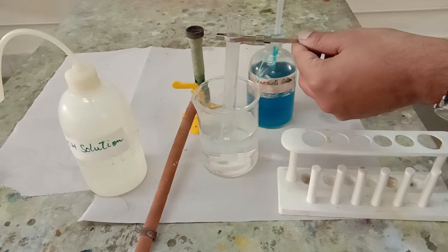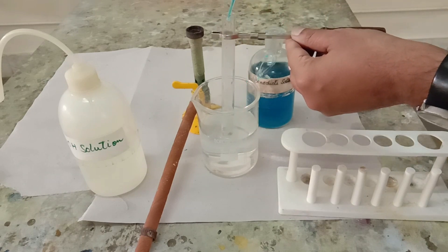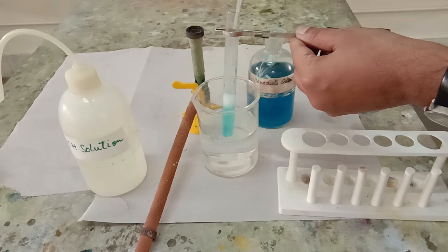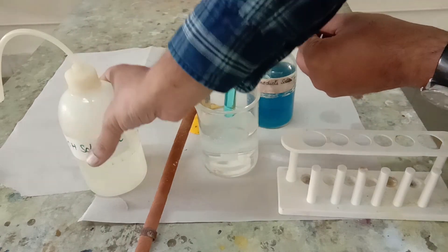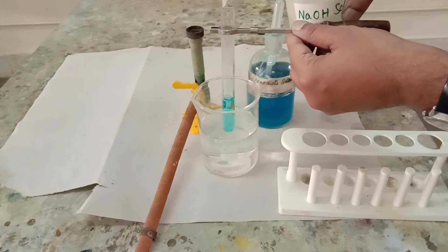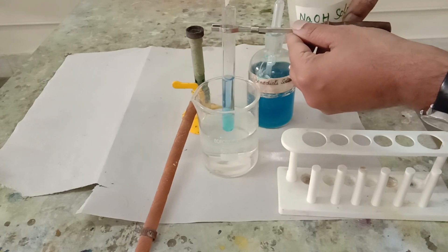Now I am going to add about 1 ml of Benedict solution into the mixture. Then, to neutralize the acidity, I am going to add about 1 ml of sodium hydroxide solution into the food sample.